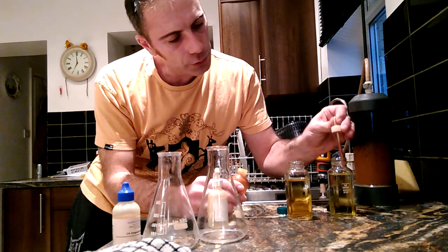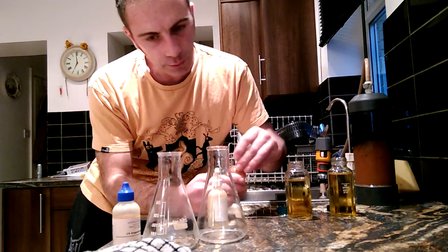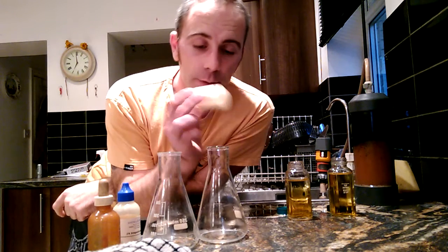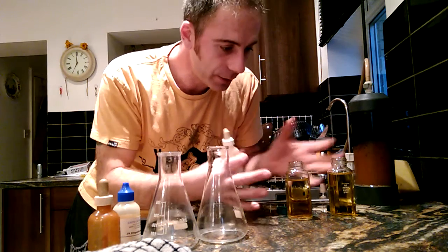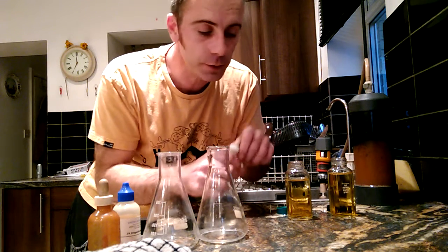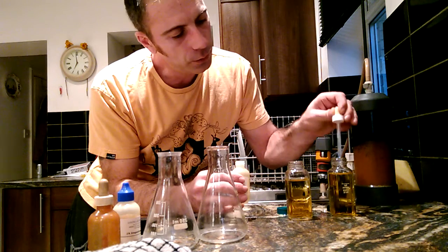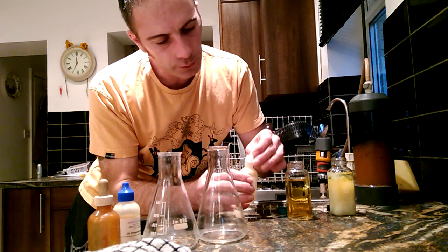We're going to put three pipettes of each in — one, two, three — one, two, three. The second chemical we need to add is potassium hydroxide. Potassium hydroxide is basically a bleach and a bonding agent — the bonding agent will coat itself around the impurities and we'll be able to see if there's anything in the water. Three pipettes of each again — one, two, three — one, two, three.